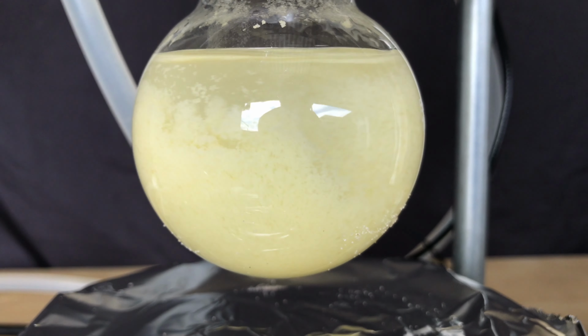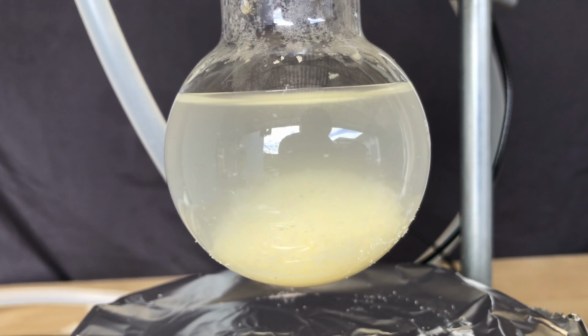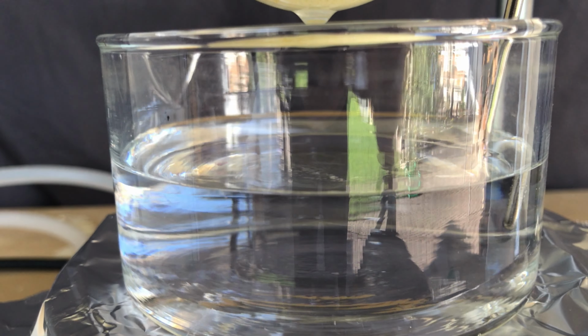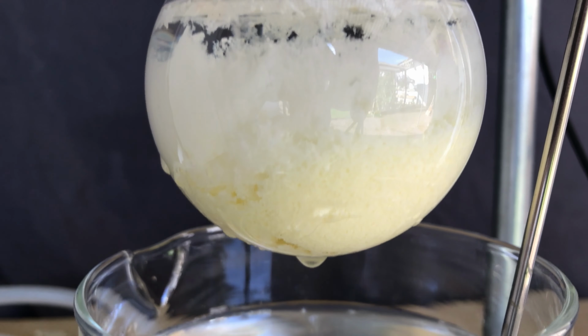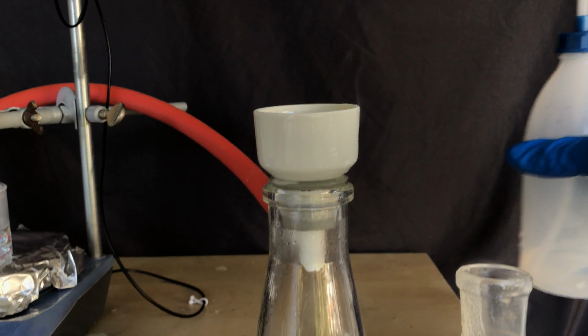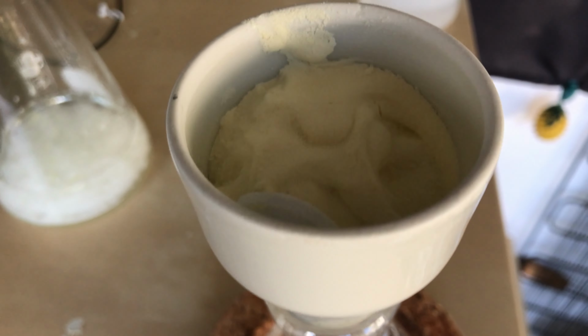Anyways, in the end I let it cool down and it looked like we got some precipitate, therefore I filtered it while hot to get rid of the other stuff, and we ended up with two different types of precipitates, which I have no idea how to analyze. I guess we just need more solvents, and I'm eventually going to try this again.